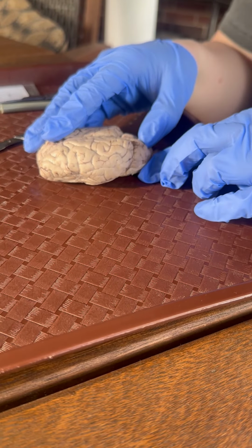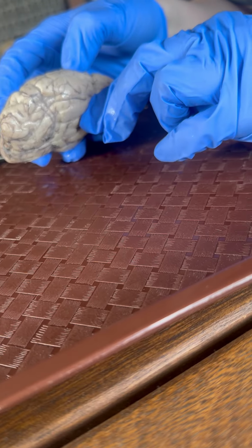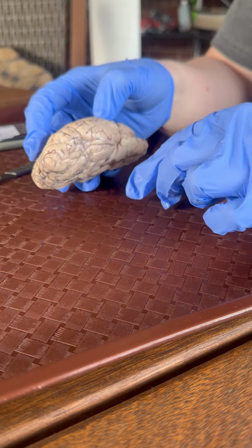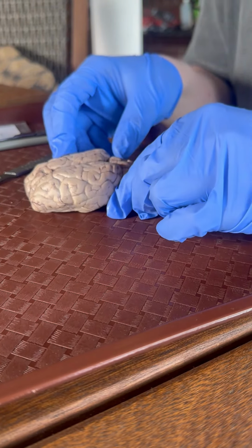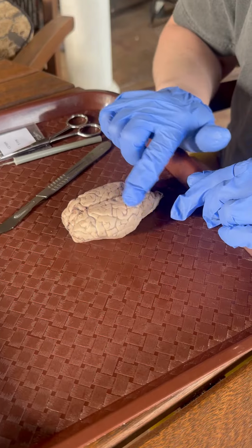So that's right here. And then the midbrain is right here, and it controls right through here. It helps with motor movement, visual processing, and auditory processing. So the midbrain can't be forgotten. It's important. Then I'm going to go ahead and address the different lobes. So we have the occipital lobe back here by the cerebellum.